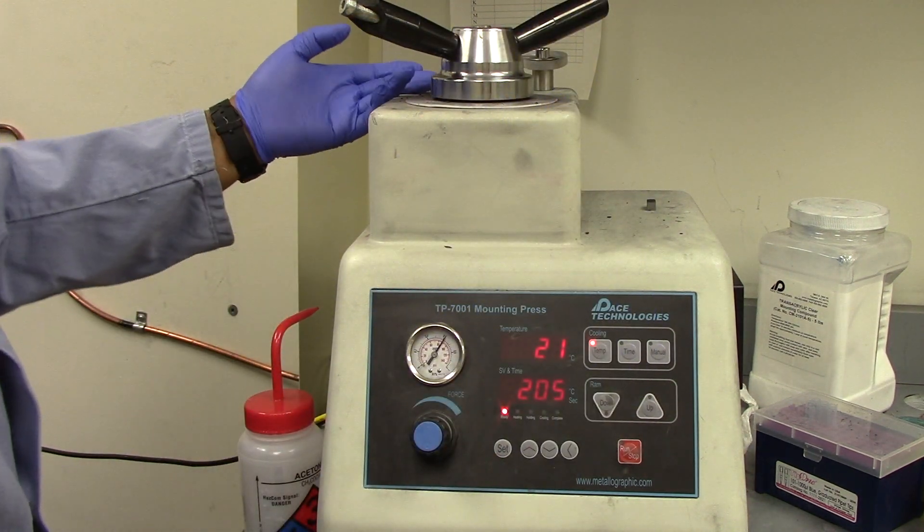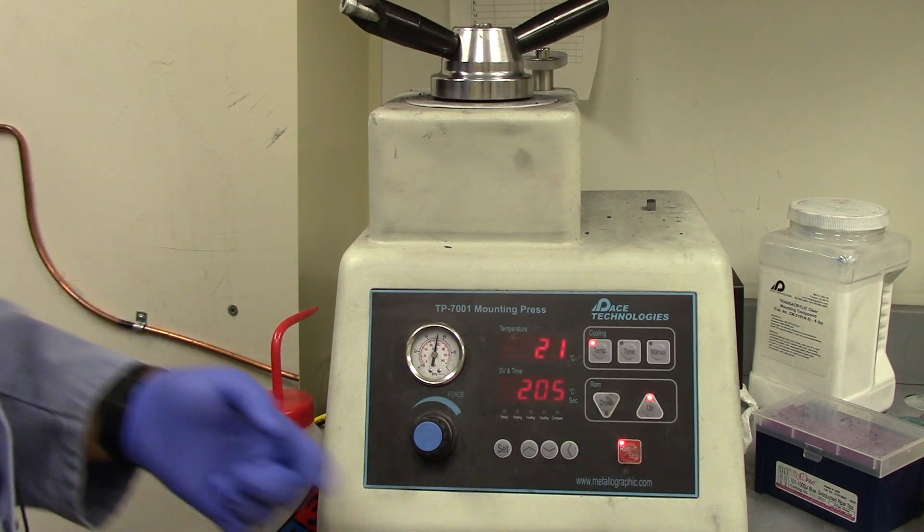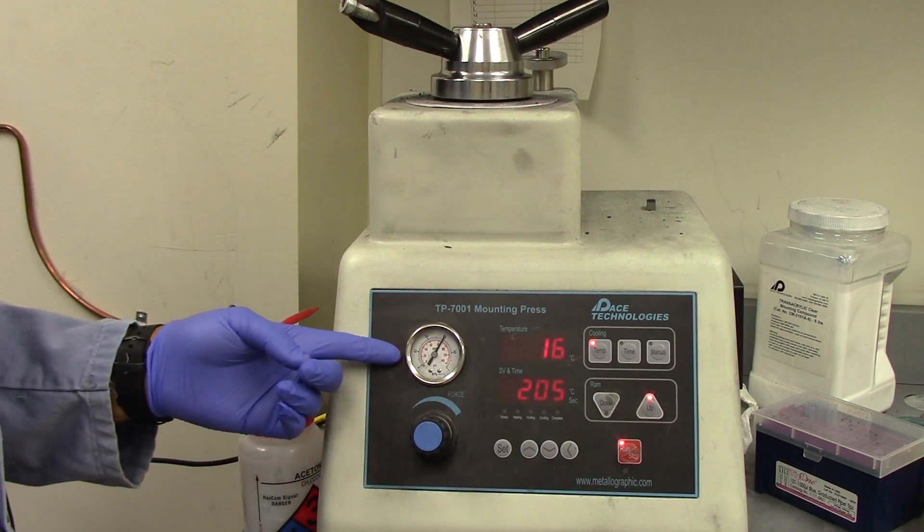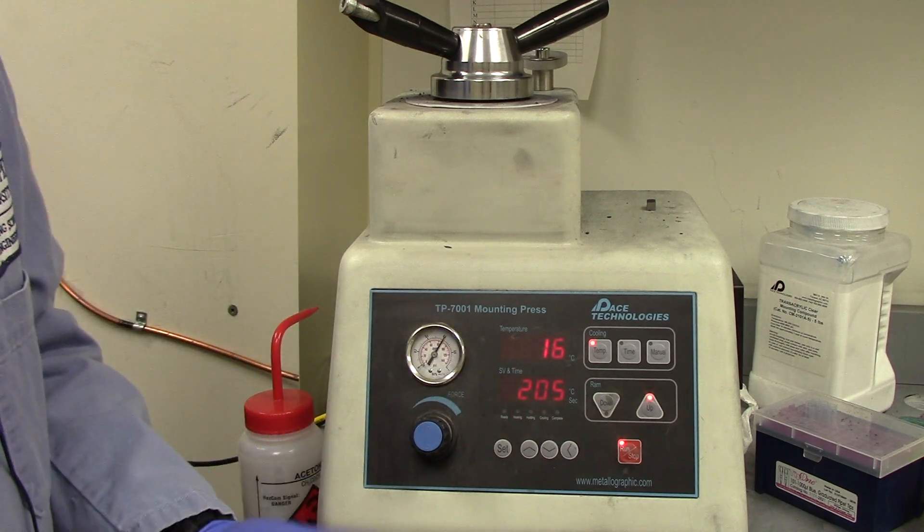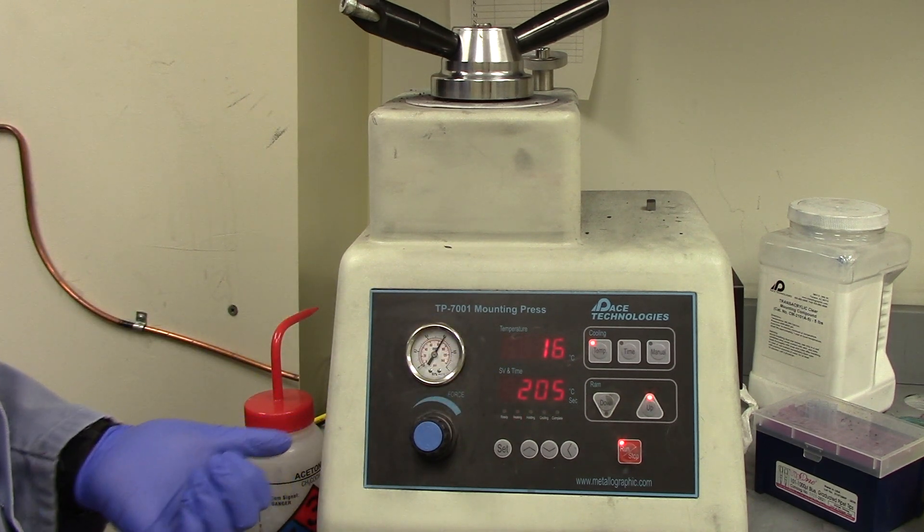Now, once that's set, I'm just going to press run/stop over here. It's going to increase the pressure and start ramping up the temperature. In probably about 20 minutes, I'll be able to have my sample mounted.